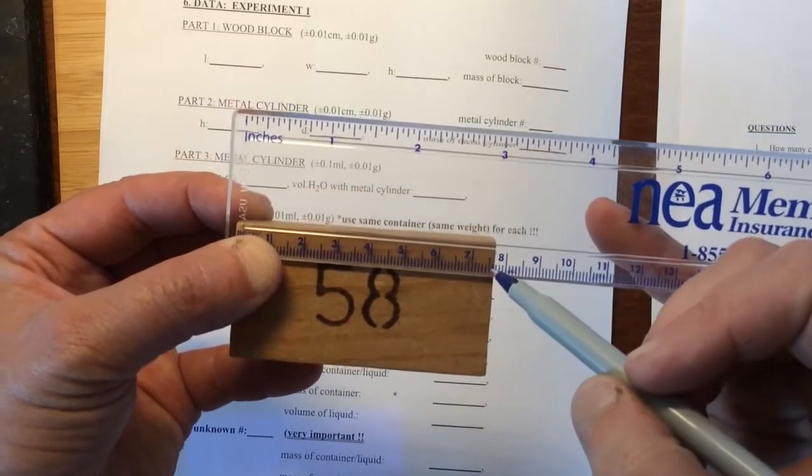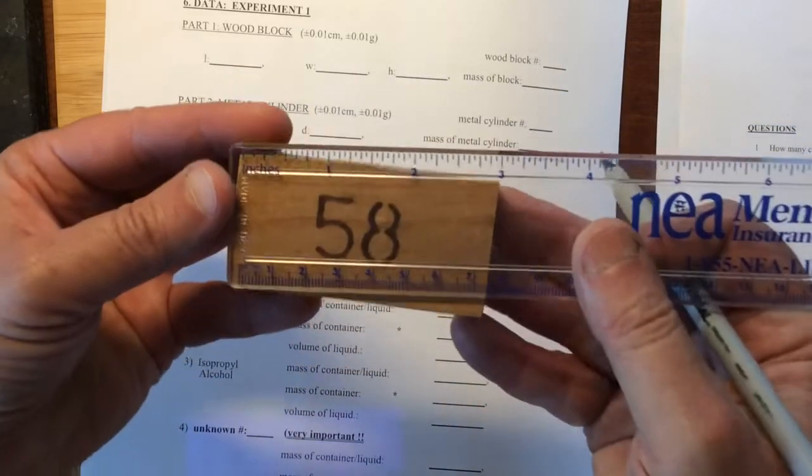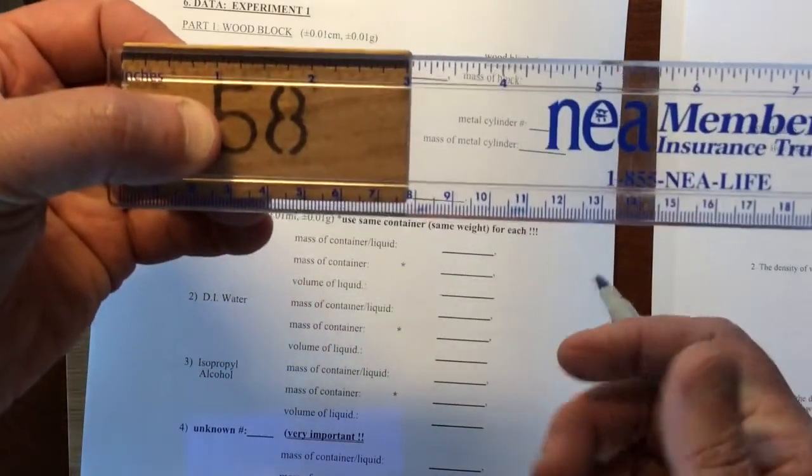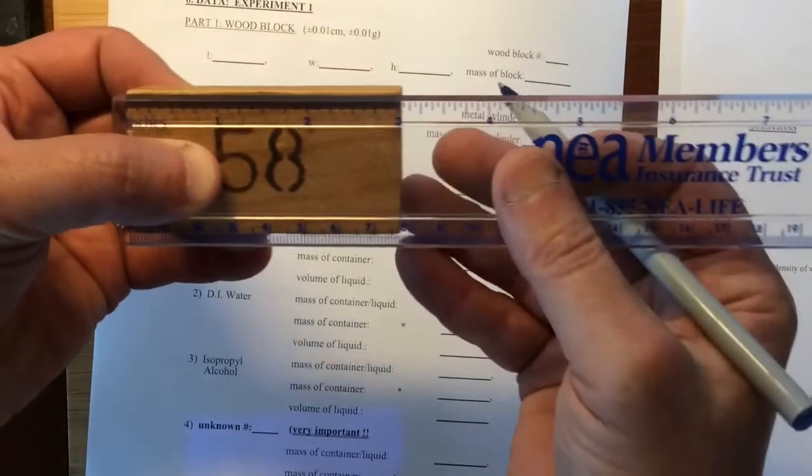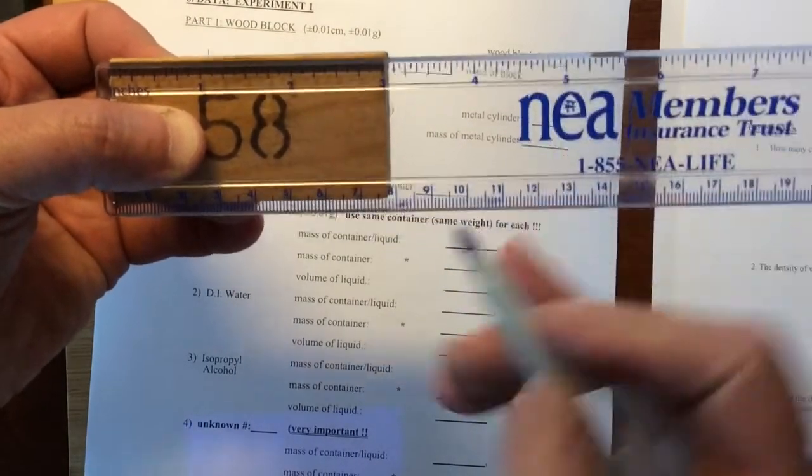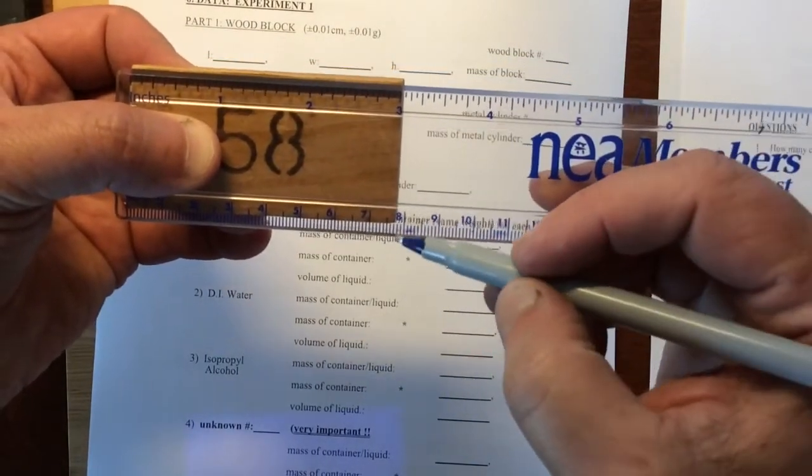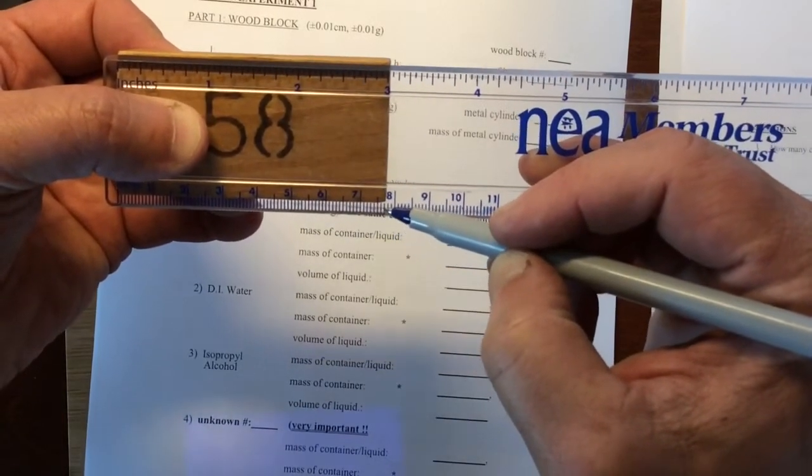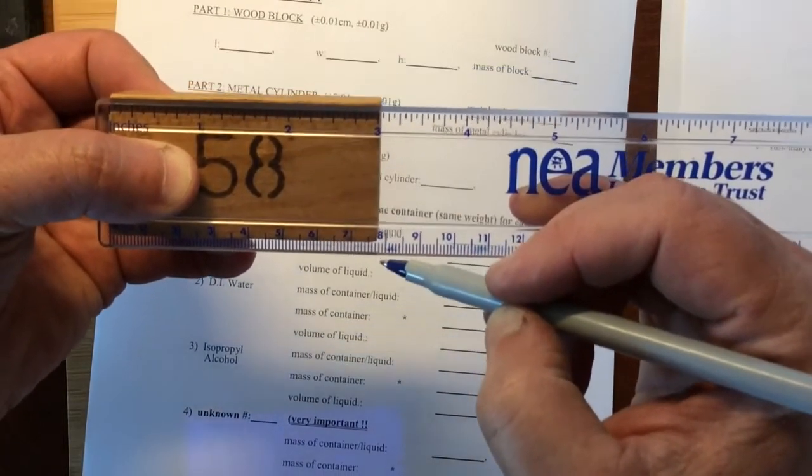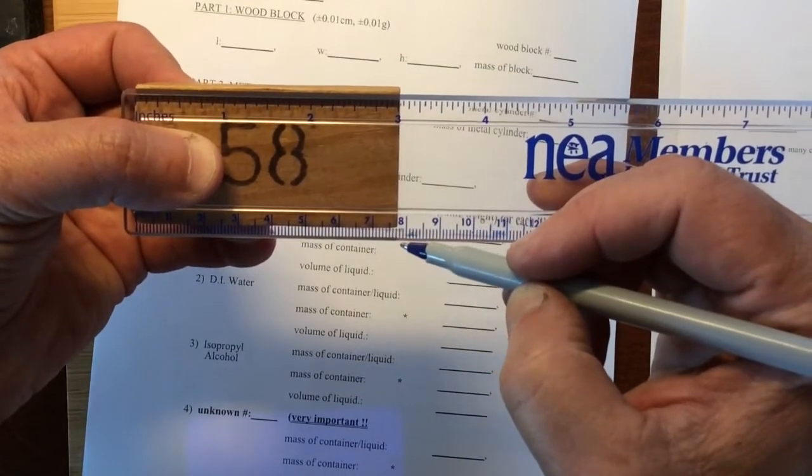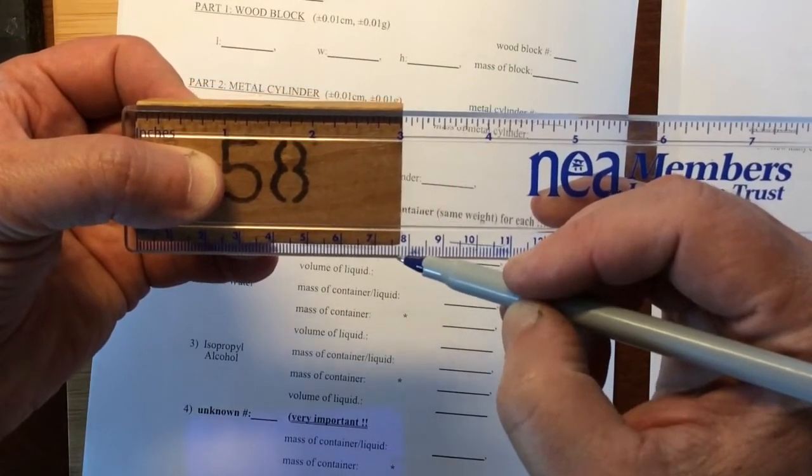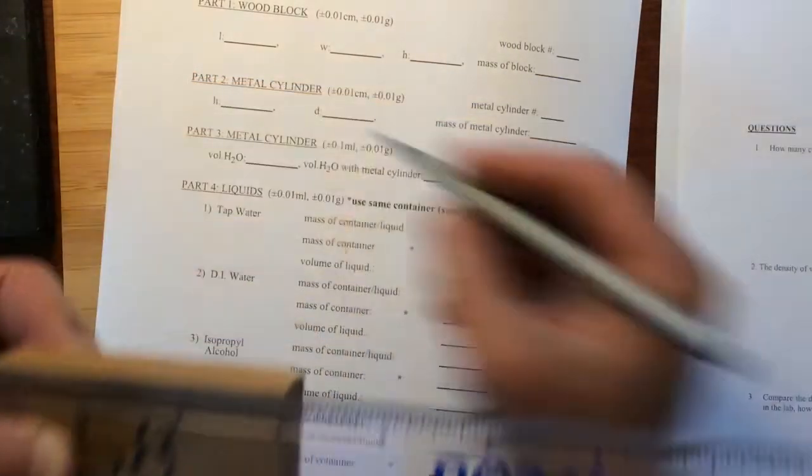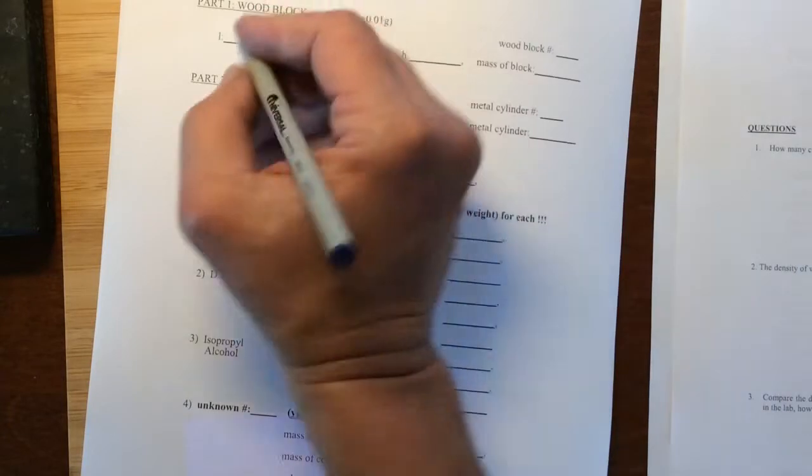Here's the .5 mark. 7.5, 7.6, 7.7, and then your job is to say what exactly is that? This one, we might legitimately say is 7.70. So for length here, we could write 7.70 centimeters.